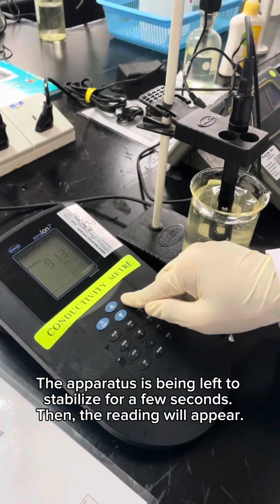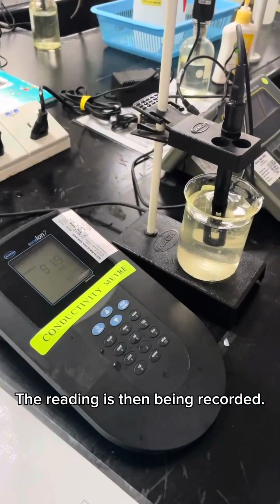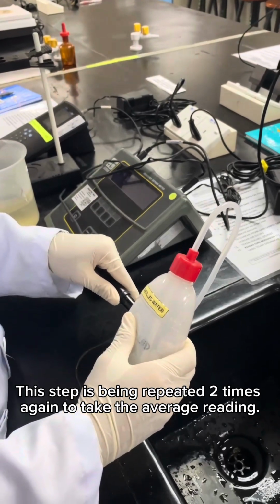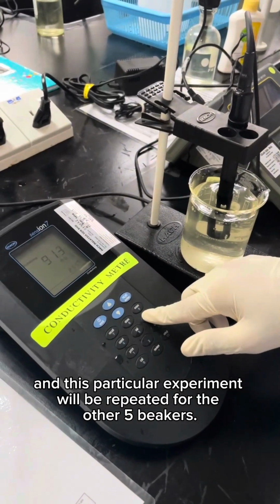The apparatus is left to stabilize for a few seconds, then the reading will appear. The reading is then recorded. This step is repeated two more times to take the average reading, and this experiment will be repeated for the other five beakers.